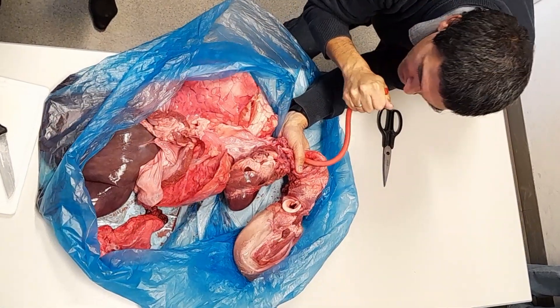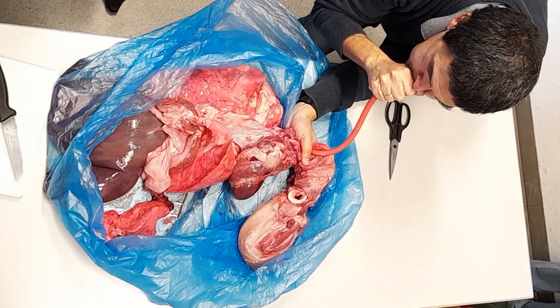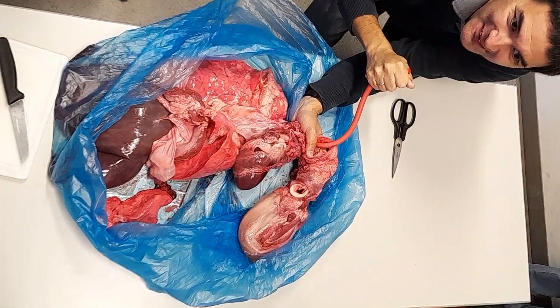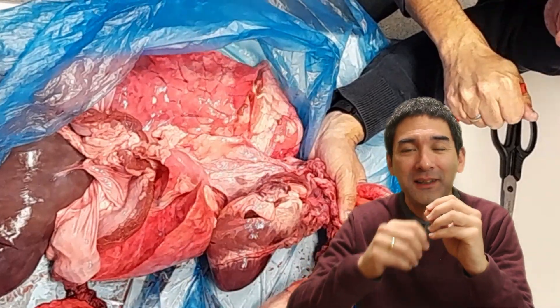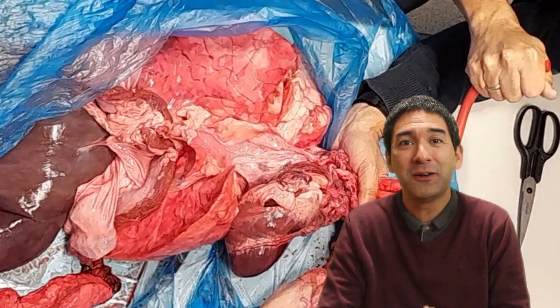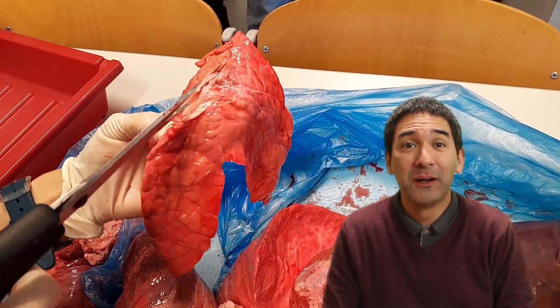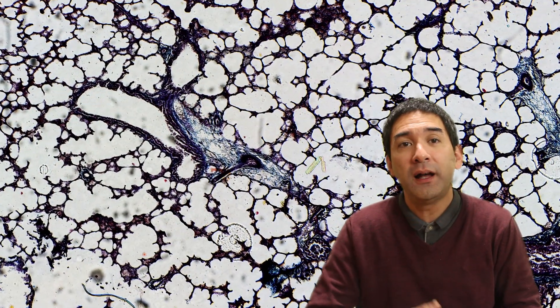Some time ago we were dissecting the organs of a pig in school. Here you can see me blow some air into the lungs of a pig — I connected a rubber hose into the lungs. My students loved it and I also had a very good time doing that, quite a bit of fun. But today I want to put the lungs under the microscope.